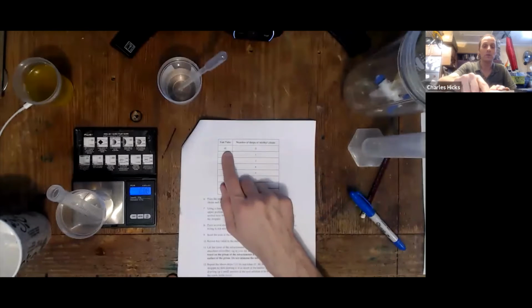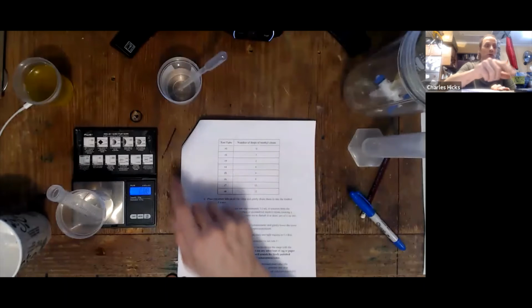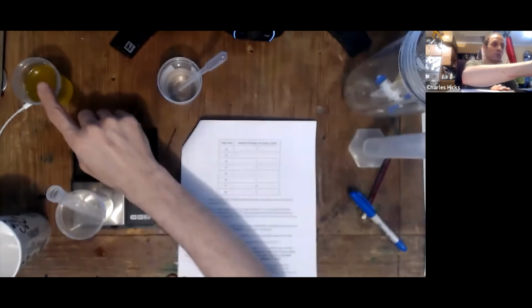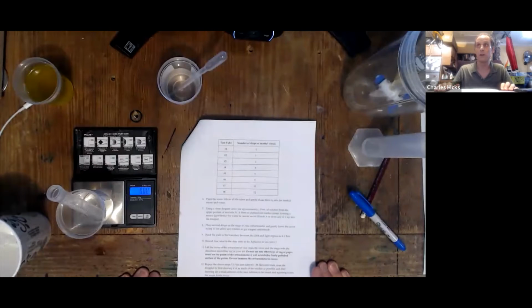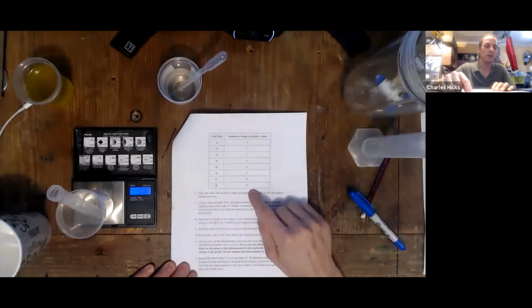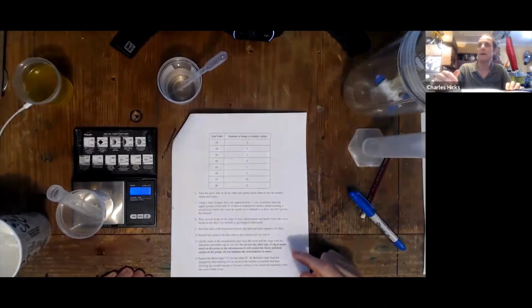So when you label a tube number 1, you just put a little bit of the water in it when you're doing the water-based solutions, and a tube number 1 similarly that's labeled for the canola oil, and you put oil in it. And then the other tubes have specified amounts of drops. So we want to measure the percentage by mass of these solutions.